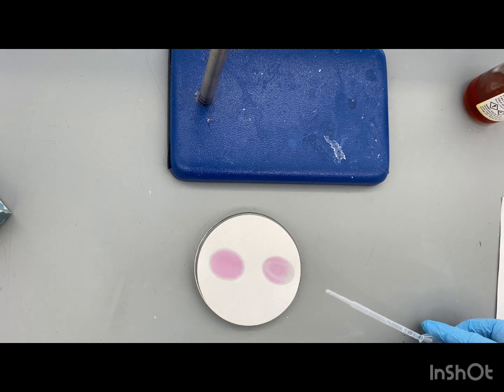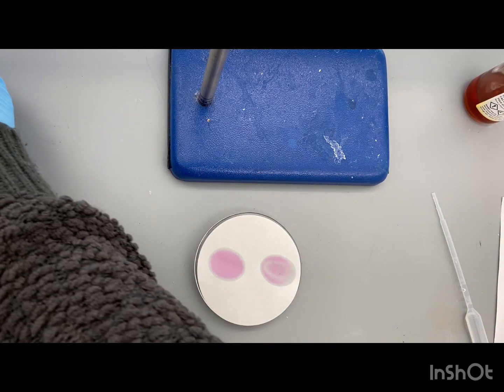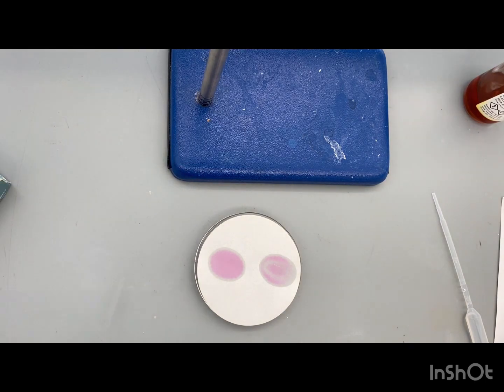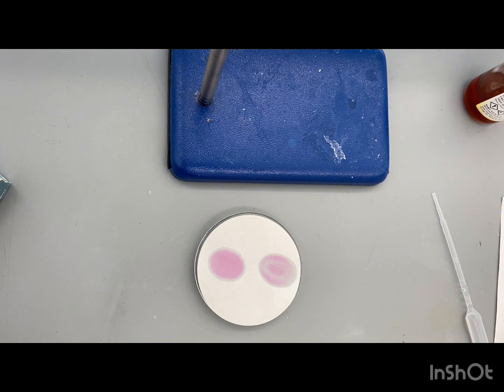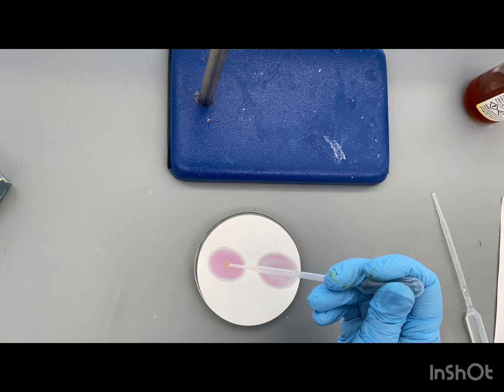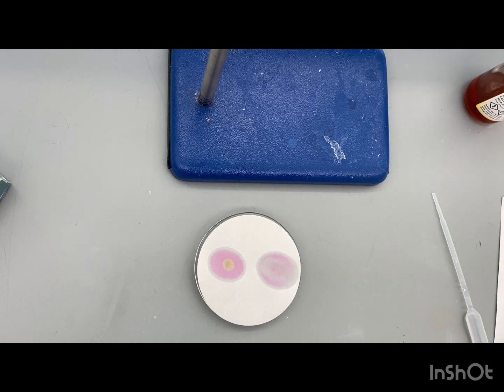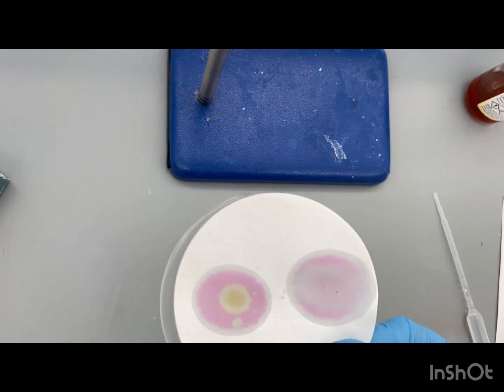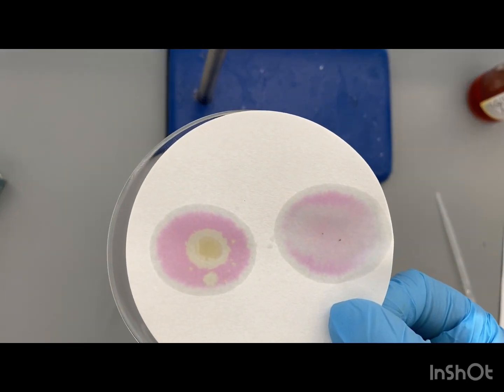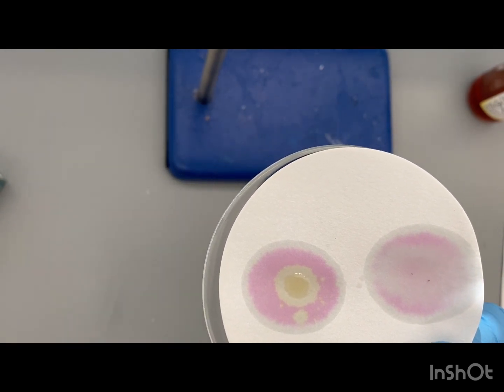As you can see, it just kind of dilutes it out. This is our product. So you can see, it is positive.